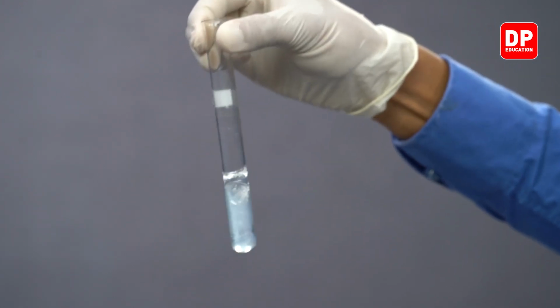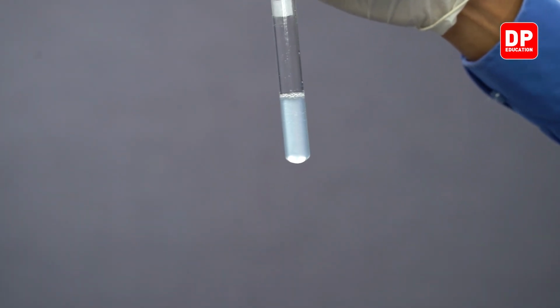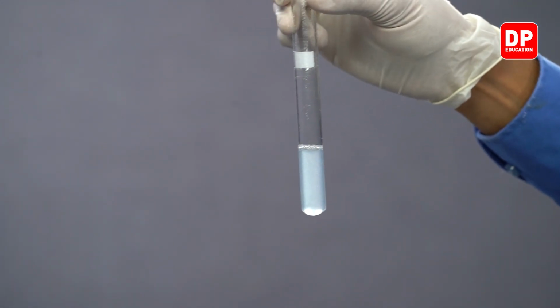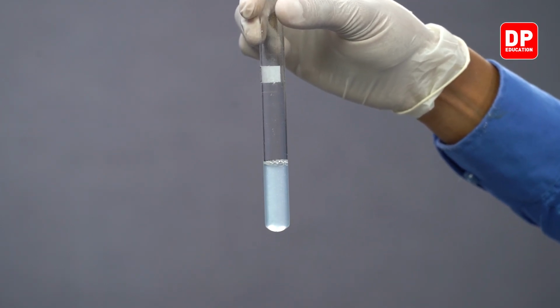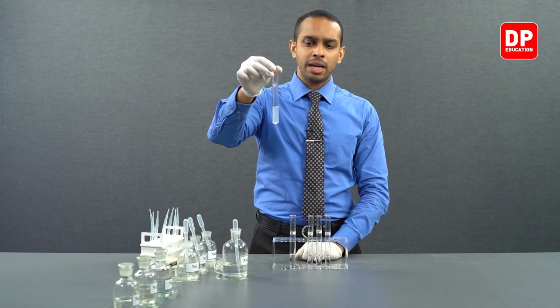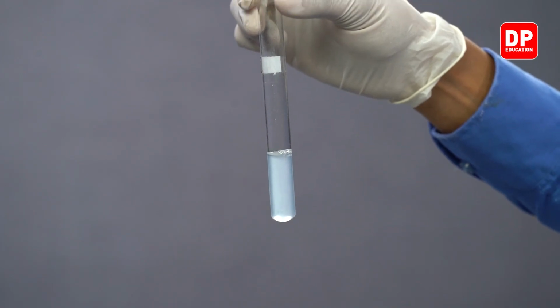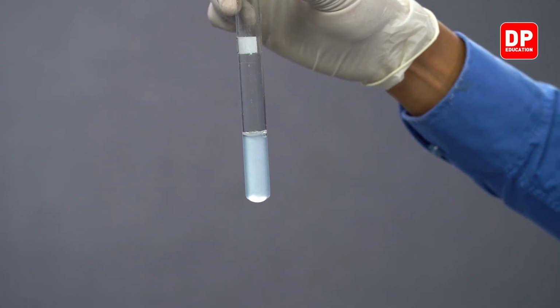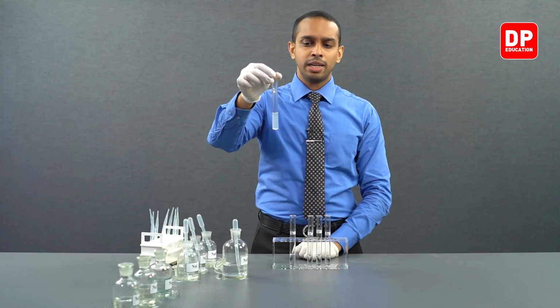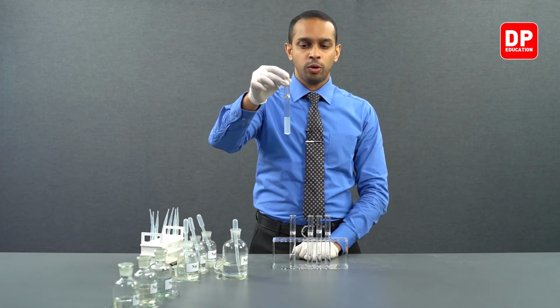Let's give it a little shake so that you can very clearly see the color of the solid suspension that we have here. We can see this is not a white color solution we have. What we have here is fine magnesium hydroxide precipitate particles dispersed through the aqueous medium, making this entire aqueous medium cloudy. So what you see here is magnesium hydroxide, which is a white color precipitate that is insoluble in water.